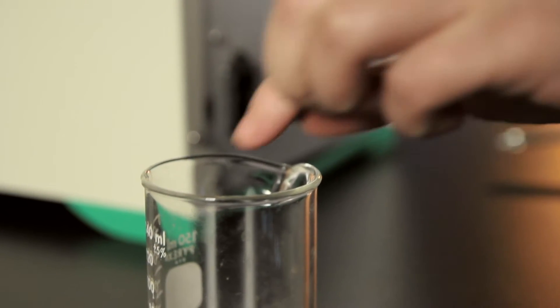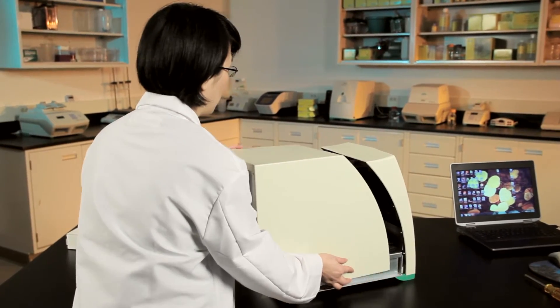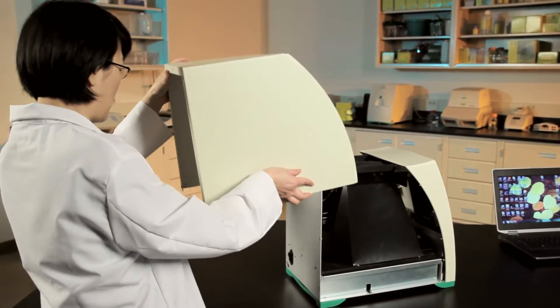Here's where that cup or beaker might come in handy. Once you've removed all seven screws, carefully slide the cover toward the back of the imager and set it aside.